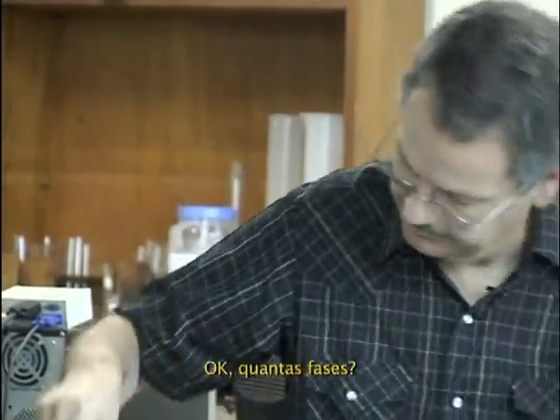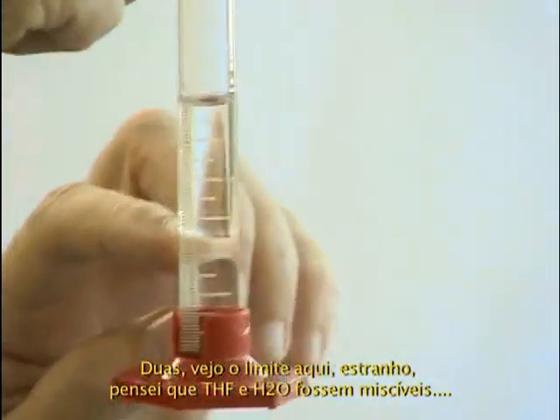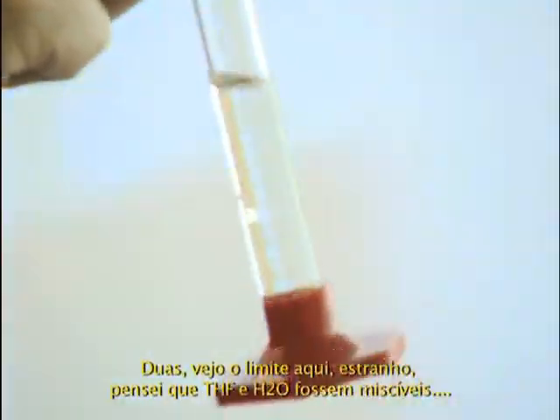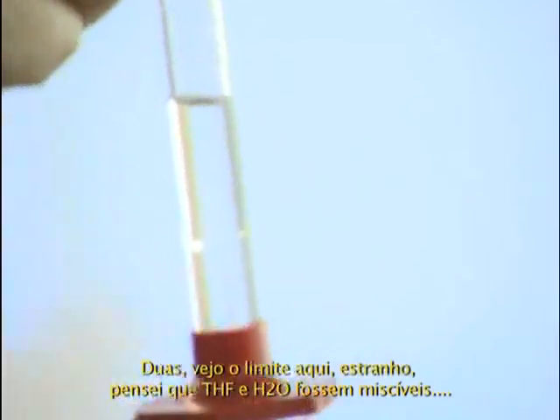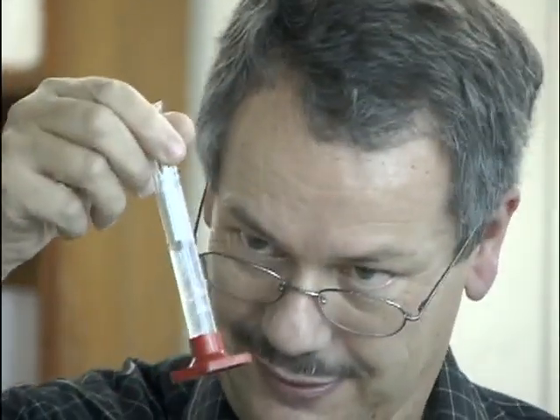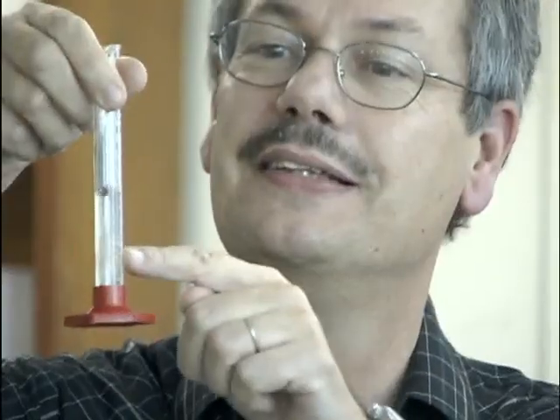Okay. How many phases? 2. I see the limit here. Strange. I thought THF and water were miscible. There is 2 phases. But if I check it, it disappears.